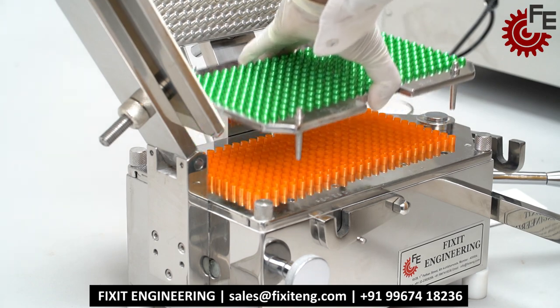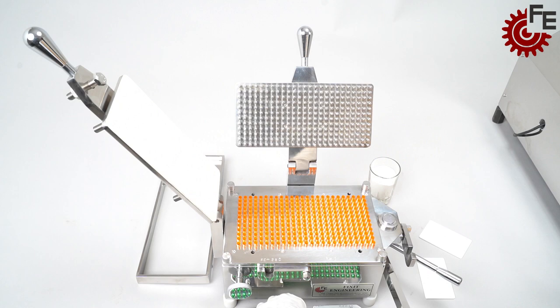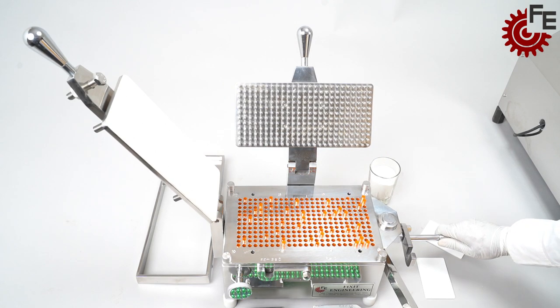Thus, the capsule cap and body part will get separated. Push the locking arm on the back side which will drop the capsule body in holes.